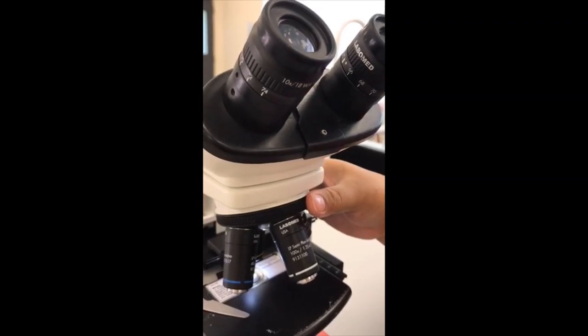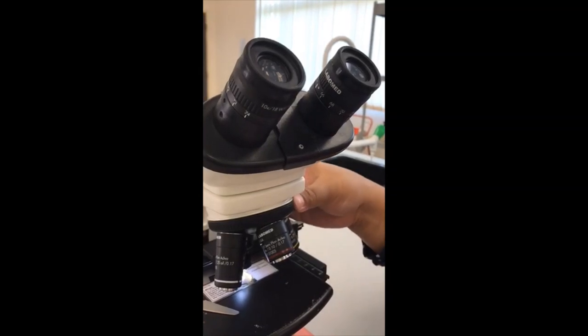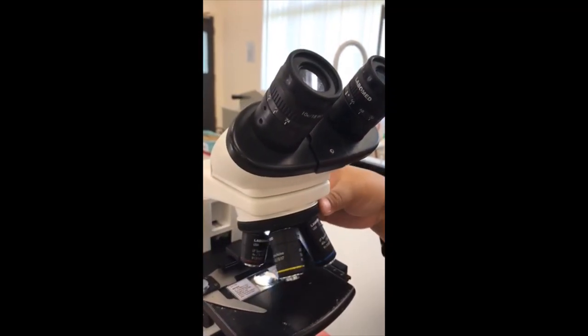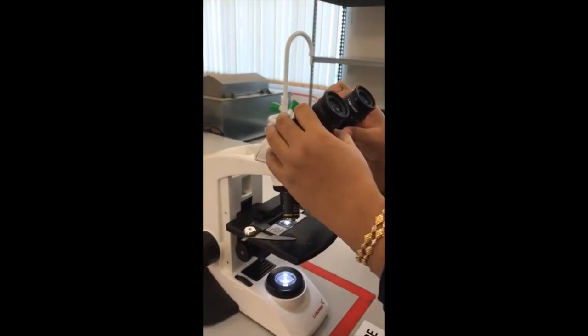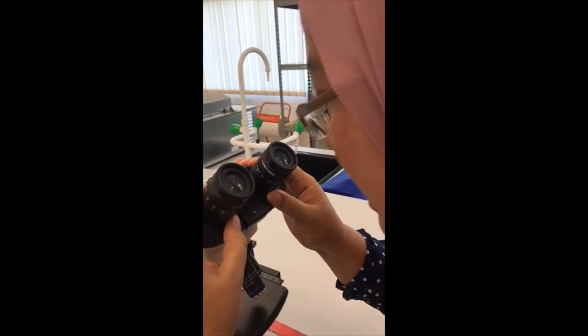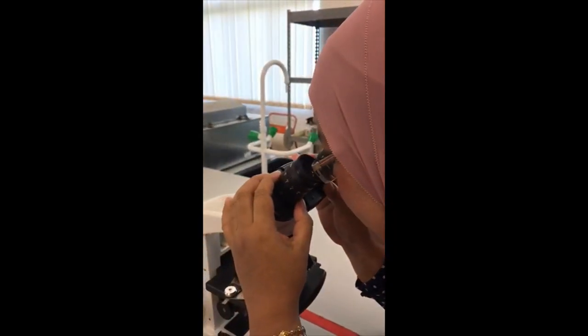The objective lens will click into position each time I move it. Now I want to show you how to use the light microscope to observe my specimen. I will place my eye at the eyepiece and have a look at my specimen.